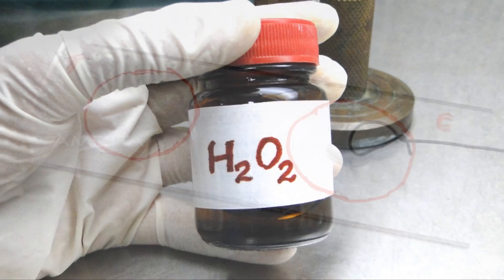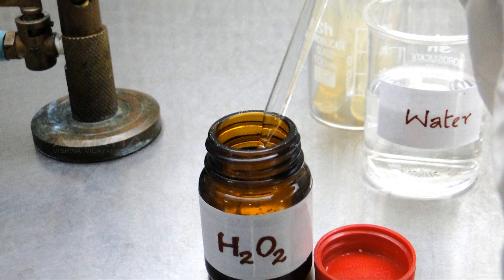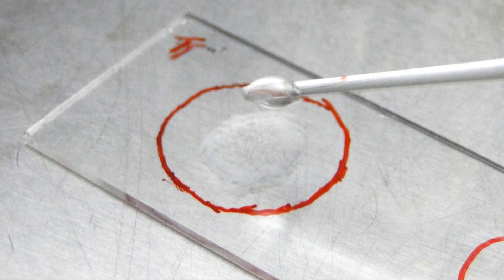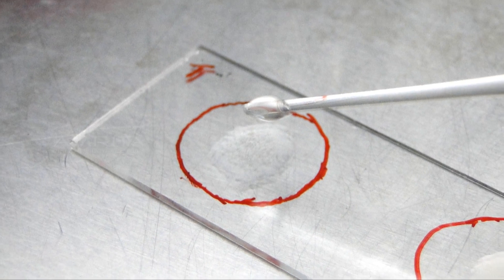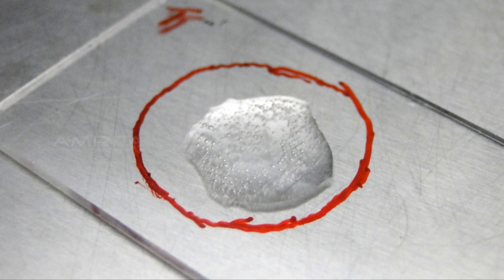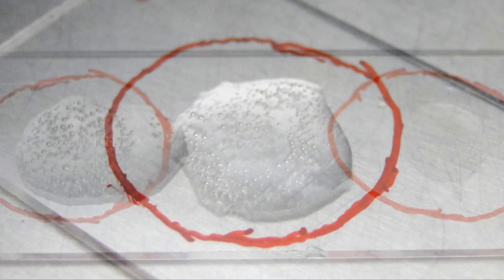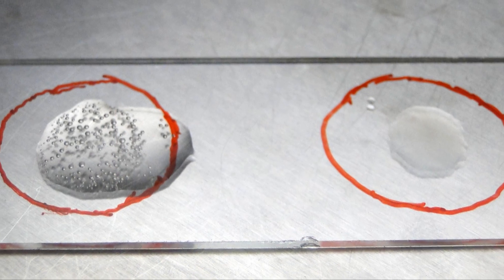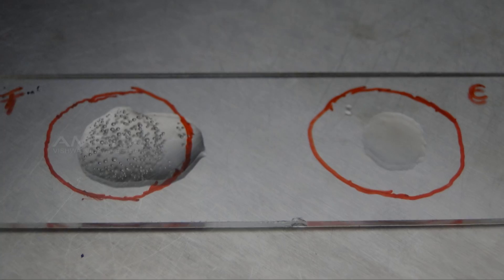Now take hydrogen peroxide. With a Pasteur pipette, place one or two drops of hydrogen peroxide over the test smear. Be careful not to run the drops together. Do not put anything on the other drop that serves as control.